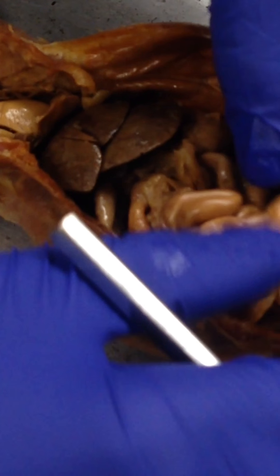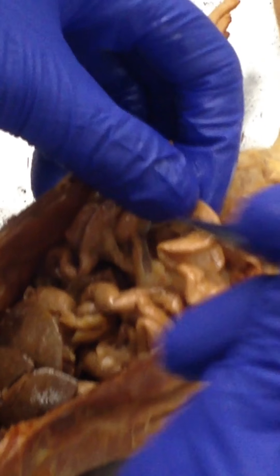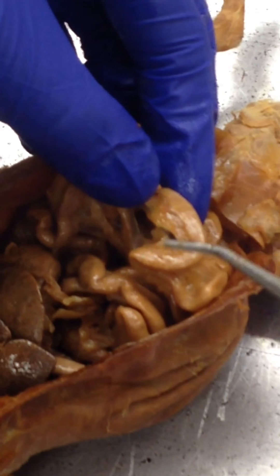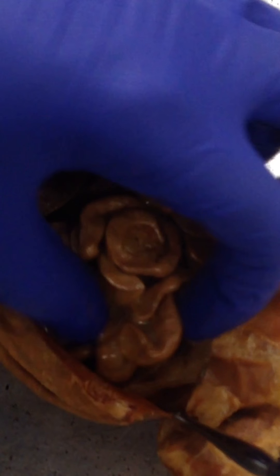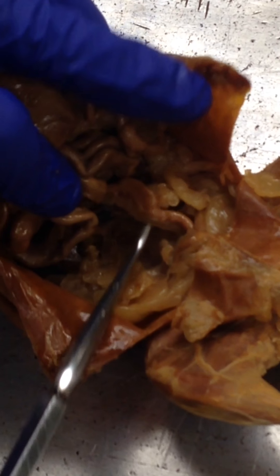The mesenteries are going to be the shiny connective tissue that you can see here — it's transparent. And the mesenteric arteries are just going to be right under the fat. The colon is under the small intestines — this is the colon.